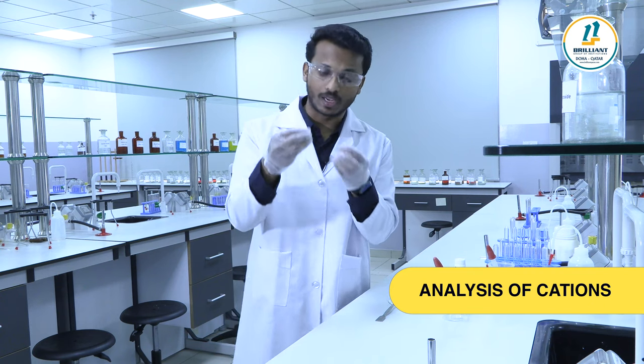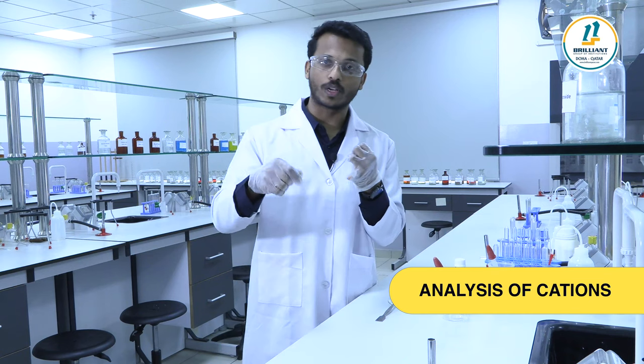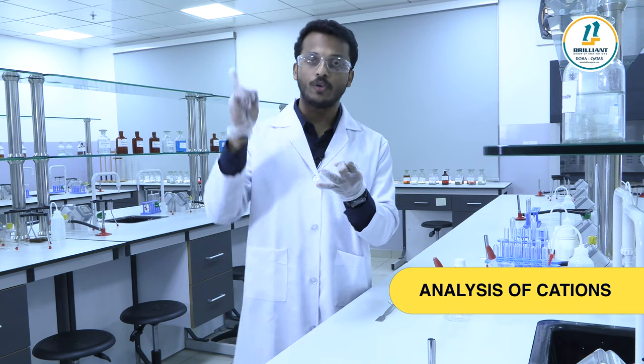Whenever doing the cation analysis we need a salt solution. Either dissolve the given salt in distilled water — cold water first. If not soluble in cold water, you can heat it; maybe it is soluble in hot water. If not soluble in cold or hot water, try with dilute HCl — cold dilute HCl and hot dilute HCl. We check solubility in water and dilute HCl to prepare the solution before doing cation analysis.